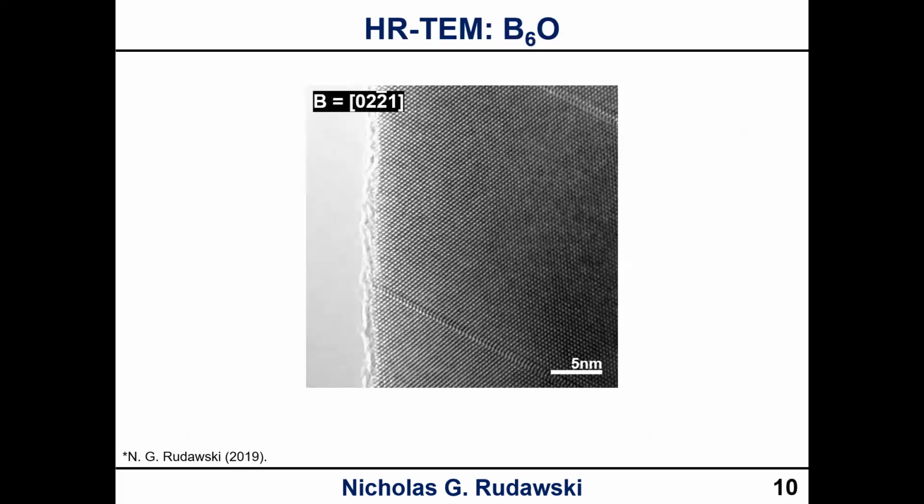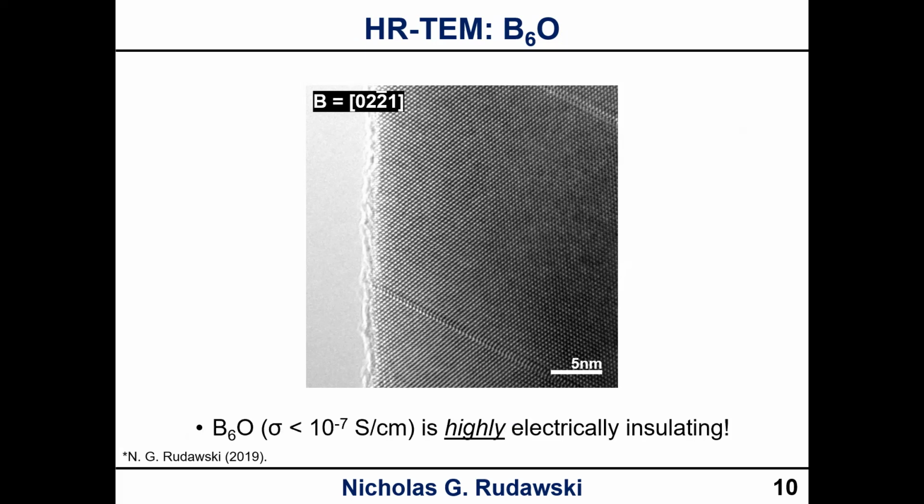Here's example 2, okay? Another very insulating material, an oxide, boron suboxide. Also taken along the same zone axis as what I showed you for the sapphire. It has a similar kind of crystal structure, but again, also is very, very electrically insulating, okay? Not quite as bad as the sapphire, but that's still really, really insulating as well, okay?